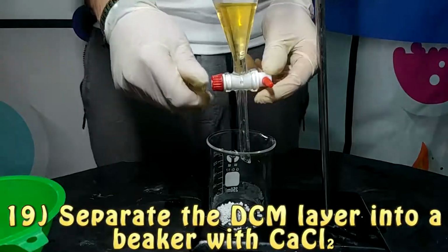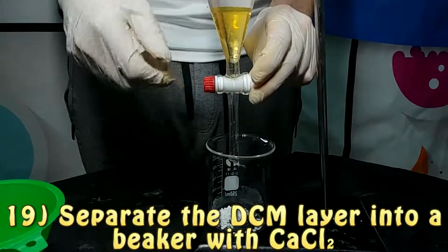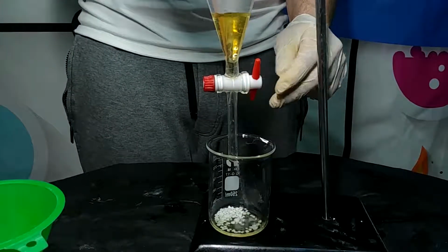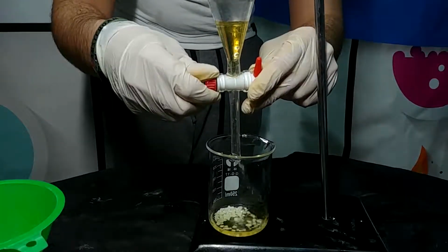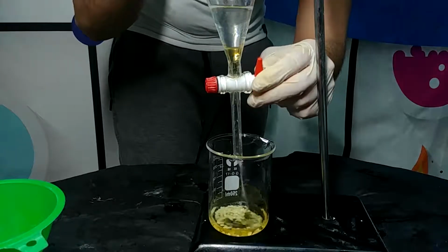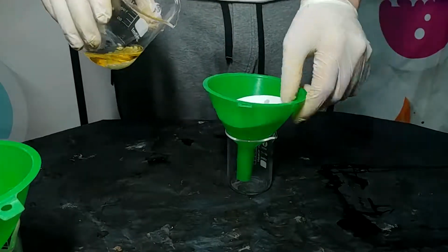So this is the dehydration step, and as you have heard, we use two substances, that is sodium chloride and calcium chloride. These are both hygroscopic substances, and that's why we use them, because in this way, when we put them in our solution, they extract from it the traces of water that are present, in order to concentrate the solution of DCM and to erase any trace of water.